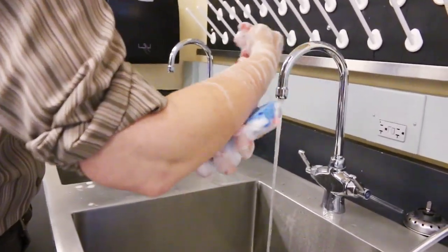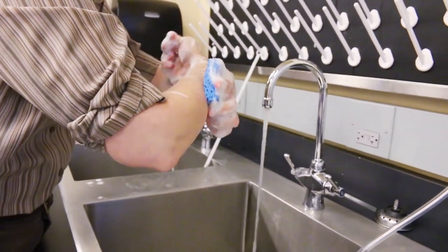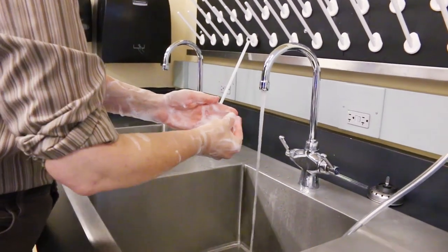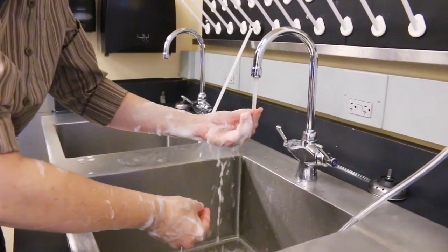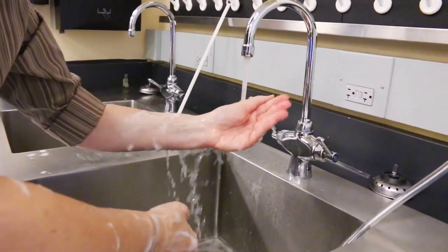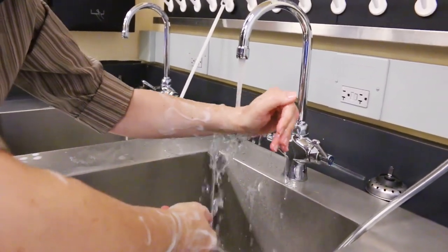Step 16, dispose of the scrub sponge without touching the waste container or its contents. Step 17, rinse your left hand and forearm holding your arm with fingers pointed up and rinsing from fingers to elbow. Repeat that on the other side.